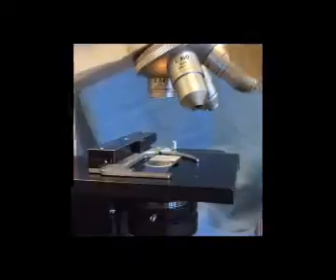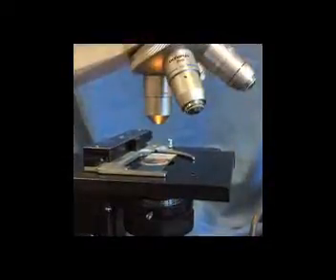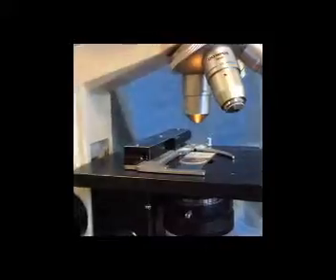So our rules are, when we're using the high dry lens and the oil immersion lens, we only use fine focus. Now, our scopes are lovely in that they are described as parfocal. That means once we have our specimen in focus using one objective lens, say for example the scanning lens, as a parfocal scope I should be able to change objectives and the specimen should remain in focus. Now our scopes are not perfectly parfocal. So what we'll be doing is getting our specimen in focus. We always start out with the scanning lens. We'll be using coarse focus. And we'll just describe how we're going to have our microbiology folks focus a specimen.